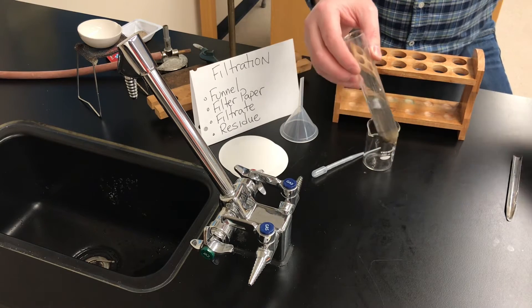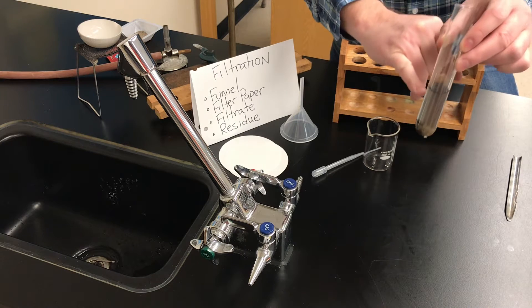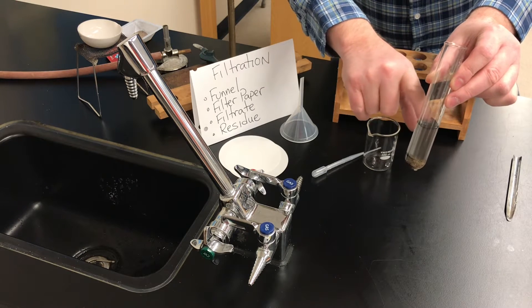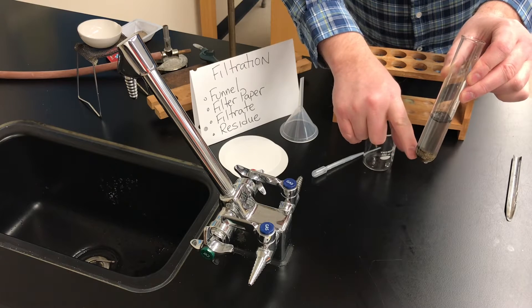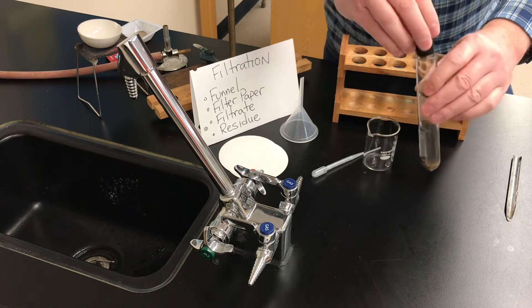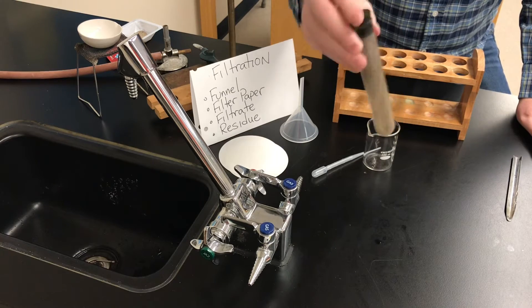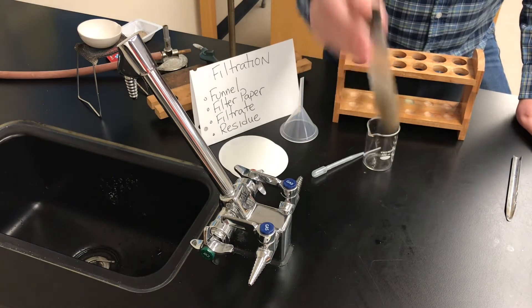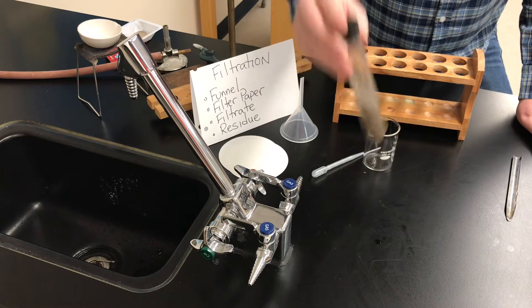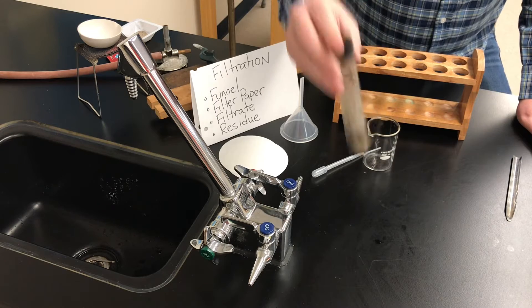I've added about a third full of water. I can already see some black charcoal suspended in the water — a little bit at the top, still some at the bottom along with the sand. I'm pretty sure the salt is still down there in the mixture. If I take the stopper and shake it up, nothing's happening to the sand or charcoal other than getting wet, but I'm pretty sure that the salt in there is dissolving in the water.